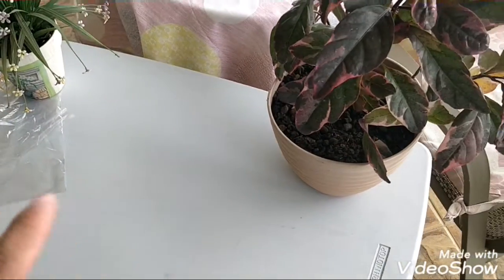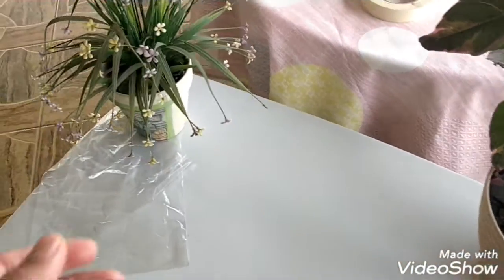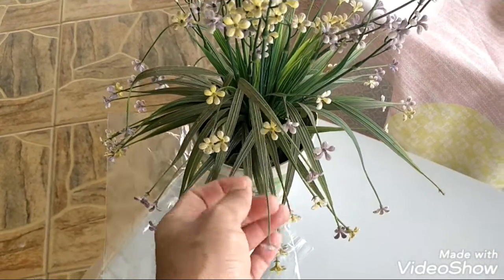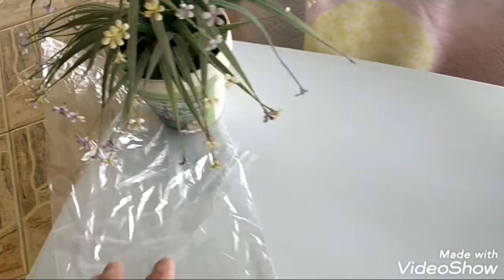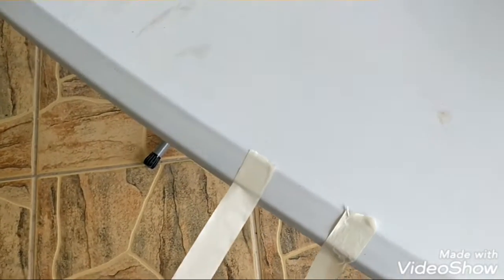So we're going to do those two experiments today — let's get started right away. Here on my table I've got my apparatus and materials ready. I've got a fake plastic plant here with fake leaves, a real plant, two clear plastic bags, and some tape to hold the bags in place.